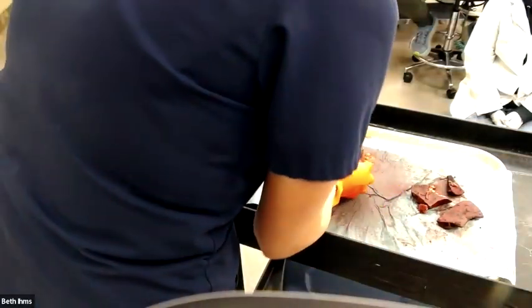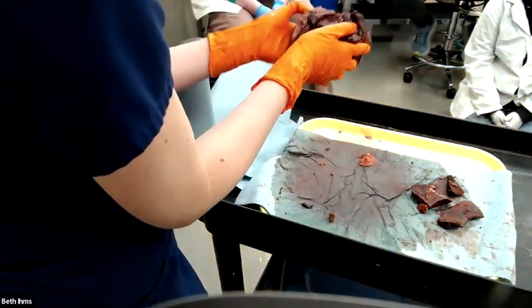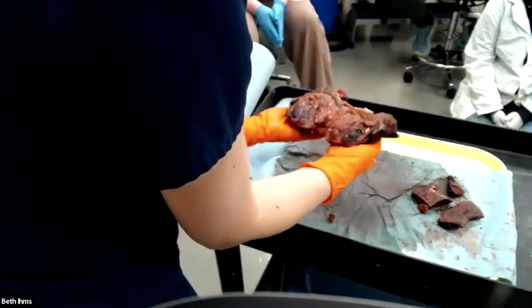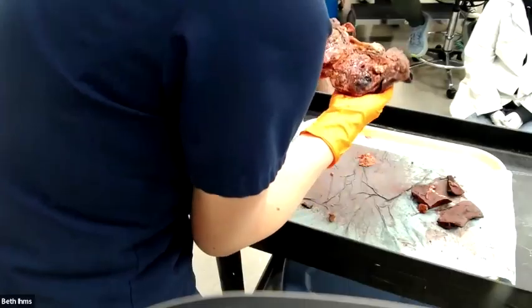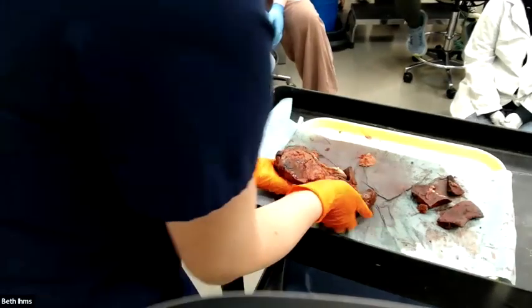Other descriptors. Let me start with my big first sentence. I can't tell what lobe this is, so I'm just going to make one up. I would say focally, massively expanding and replacing whatever lobe this is of the liver is a focal, large, maybe softball size mass. Uncut section, it's fairly well demarcated, but there are some areas where individual nodules are seen outside of the main mass. It is partially encapsulated.